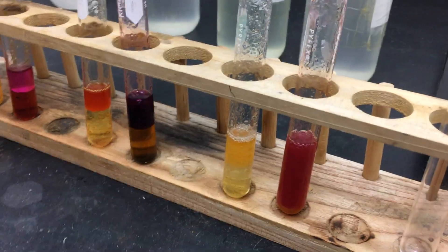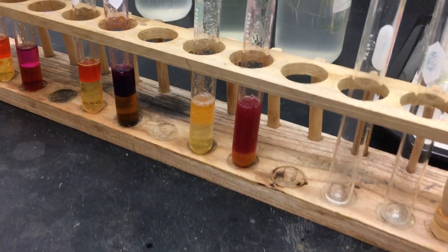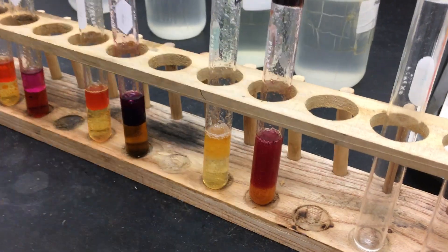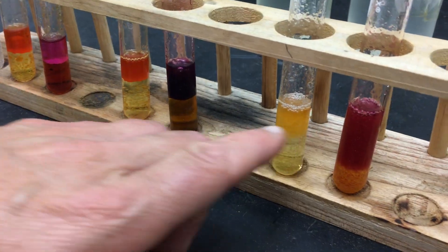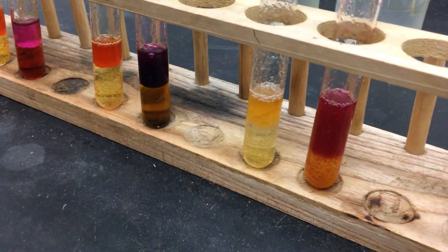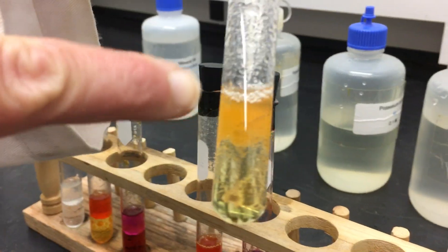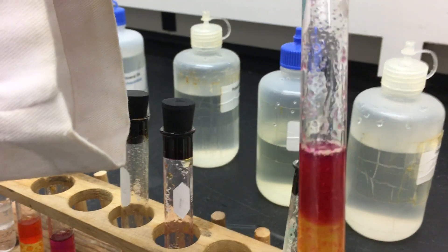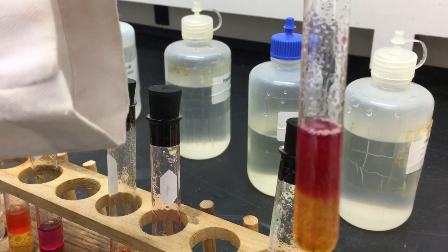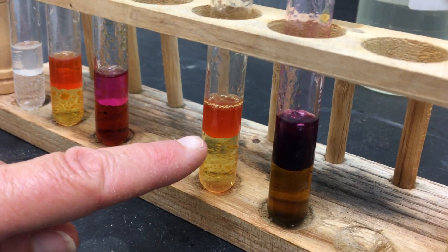Let's think about what just happened. We added chlorine water, which is pretty much a very clear color. Now if we look at the top layers of our two test tubes — we started with chlorine, which is clear, and notice the top layer is now turning more of an orange color. And when we look at our other test tube, notice the top layer has a very nice purple color. Going back to our previous test tubes, we now have good separation of layers — a clear purple color and the orange color.